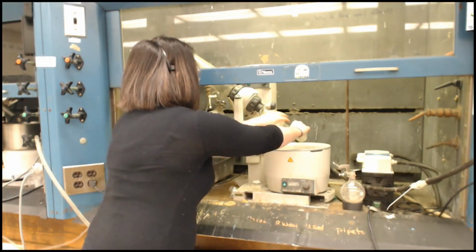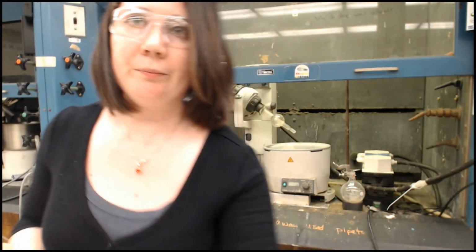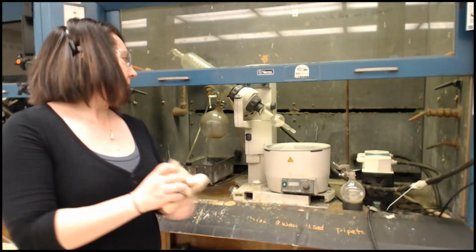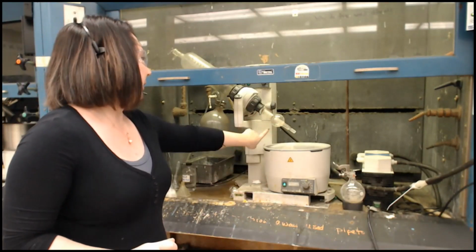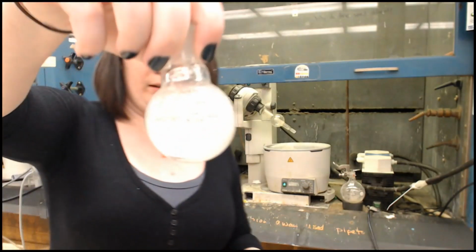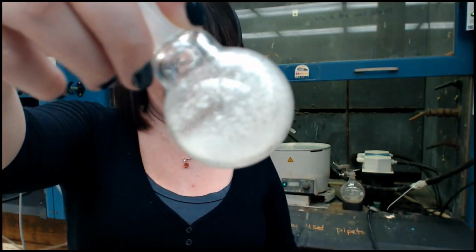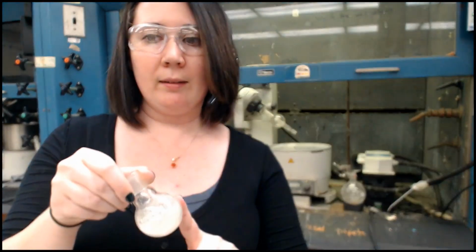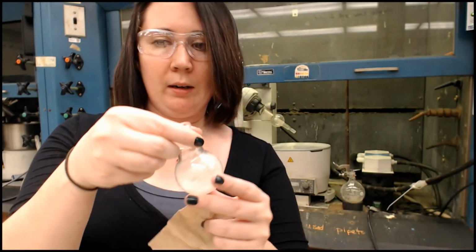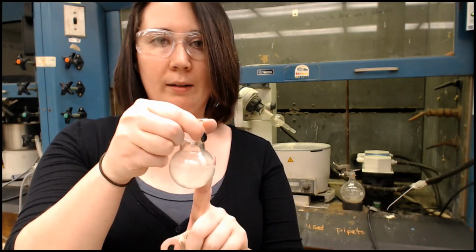If you try to take it off while the vacuum's still running, what can happen is some of the material can get pulled back up into it, which is kind of what you see here, if you can see that far. So here is our sample. We see a bunch of white powder around the sides. This is why we weighed this, because it's not going to be easy to scrape this out very efficiently. So this was what was in our organic layer, and yeah, so move on from there.